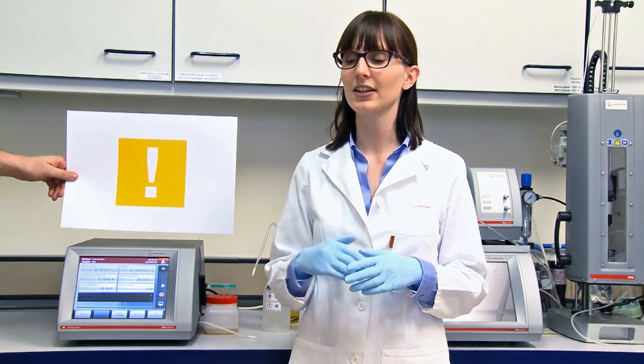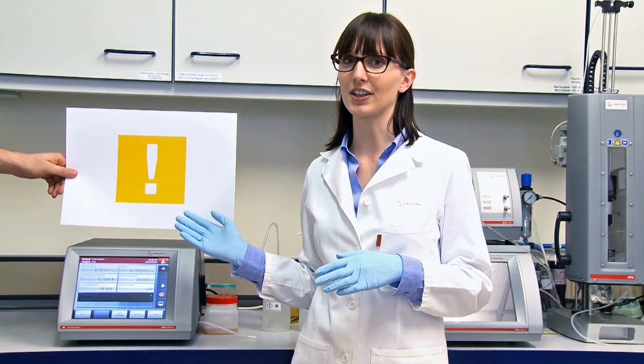The unique thing about the DMA Generation M is its high level of security and user support. If I had filled the sample incorrectly, for example with an air bubble inside, the instrument would have recognized this immediately and given a warning sign. But now let's come back to the measurement.